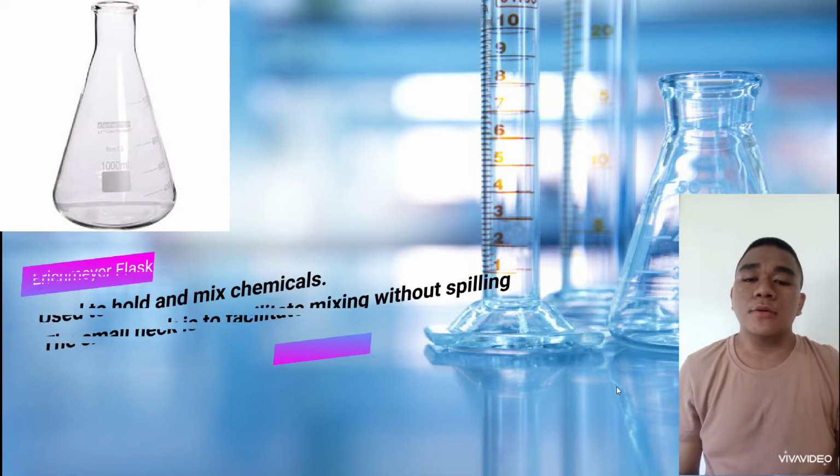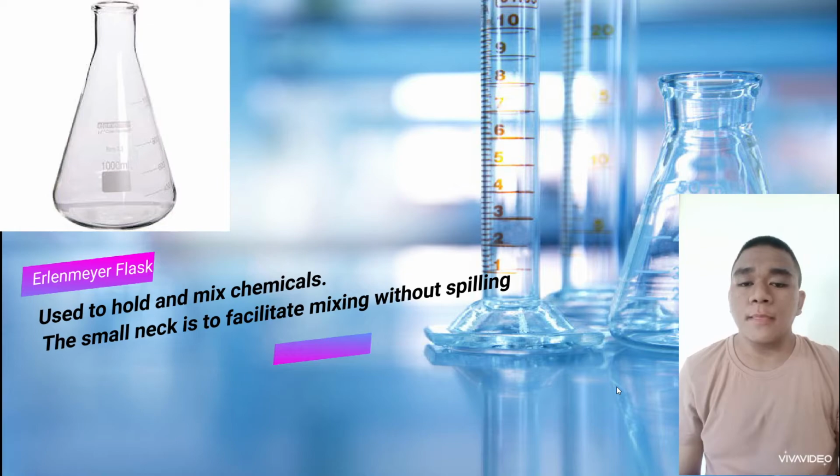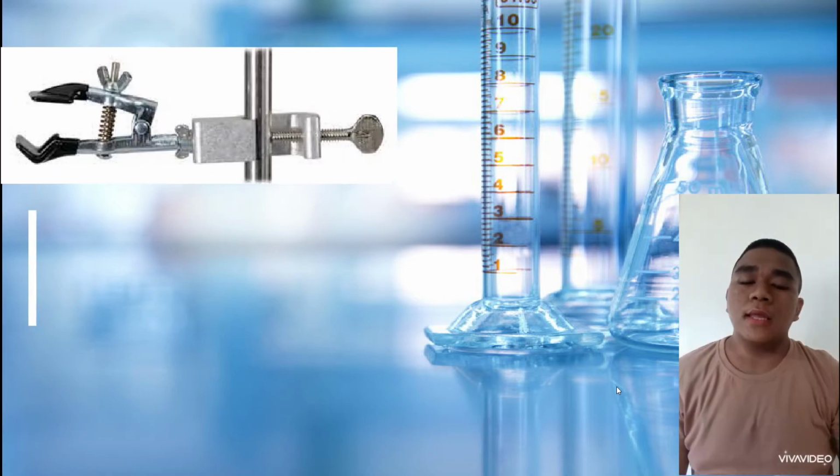Erlenmeyer flask, also known as conical flask or titration flask, is a type of laboratory flask that features a flat bottom, conical body, and a cylindrical top. The function of Erlenmeyer flask is to hold and measure chemical liquid samples, but it can also be used to mix and heat bulk chemicals.